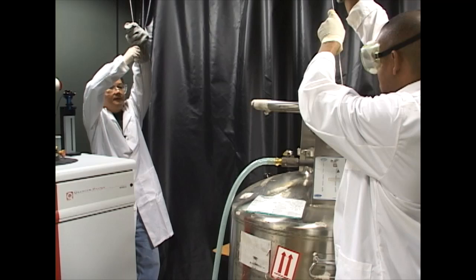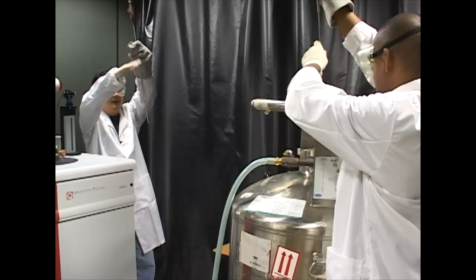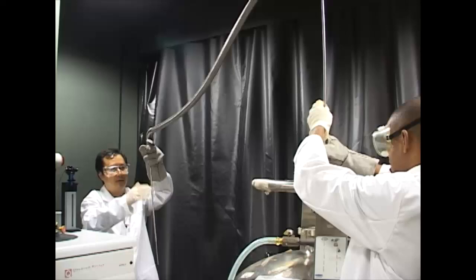The first step is to refill the SQUID device with liquid helium at 4.2 kelvins. A tube is used to siphon helium from the dewar into the device.